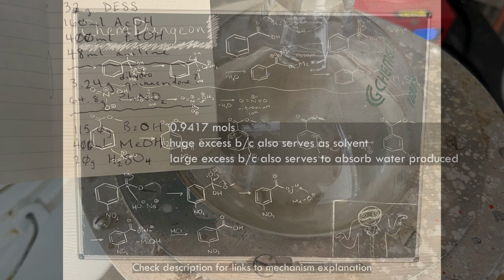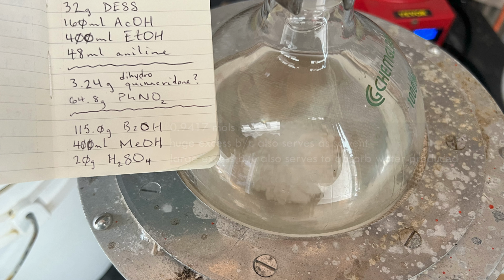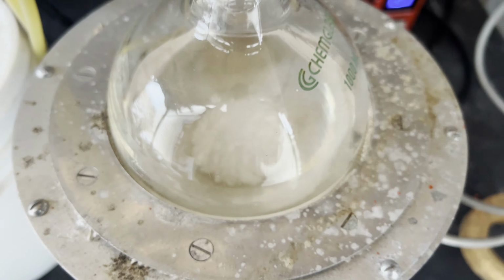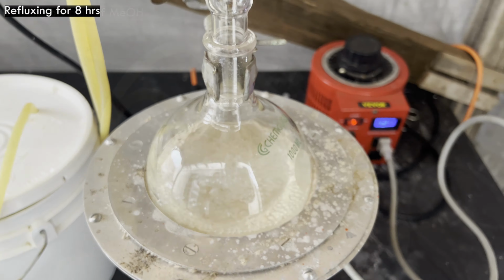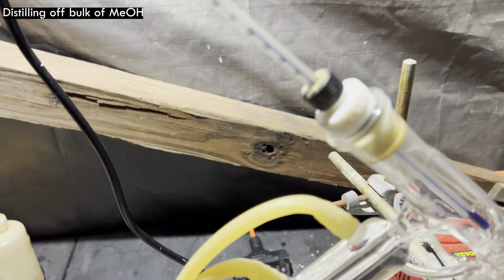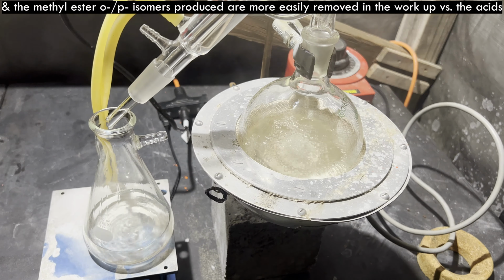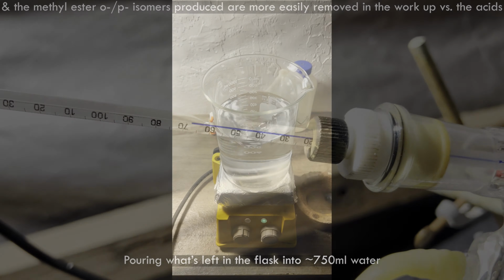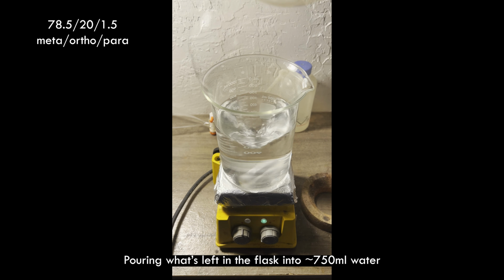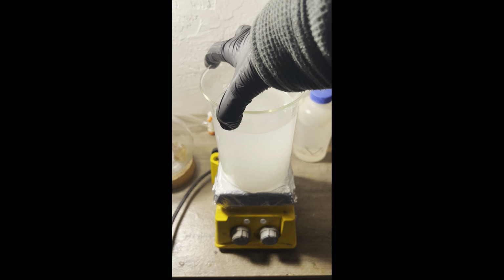On to the video. Method 1 is the roundabout high meta-isomer yielding process. First, benzoic acid and methanol are converted to methyl benzoate by Fischer-Speier esterification with sulfuric acid as the catalyst. Then, methyl benzoate is nitrated. Compared to the nitration of benzoic acid, nitrating methyl benzoate yields very little of the ortho and para isomers and mostly the meta-isomer. Nitrating benzoic acid produces this ratio of the isomers. After the nitration, the ester is saponified to the sodium salt, which is acidified to give the free acid.